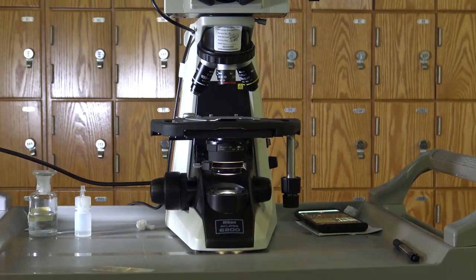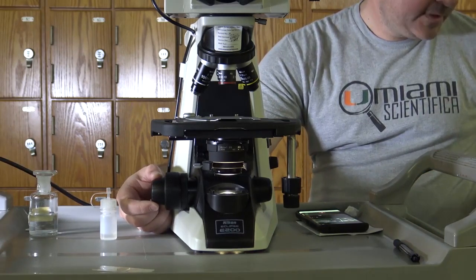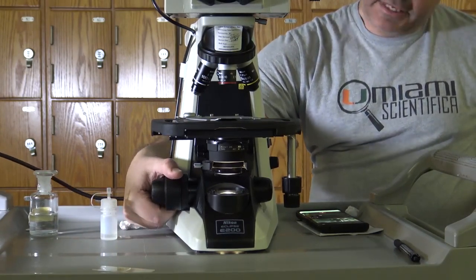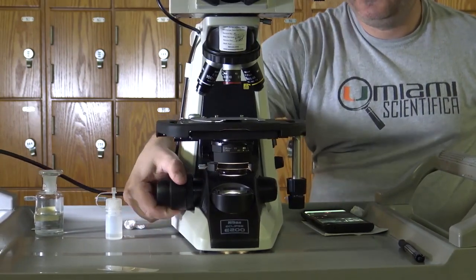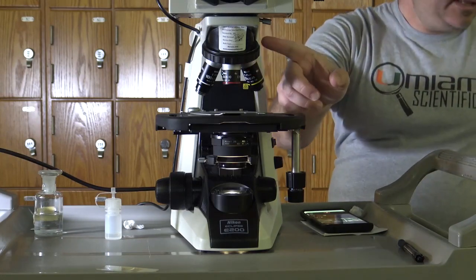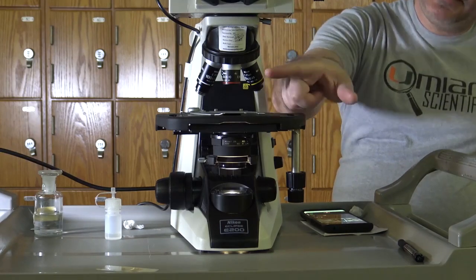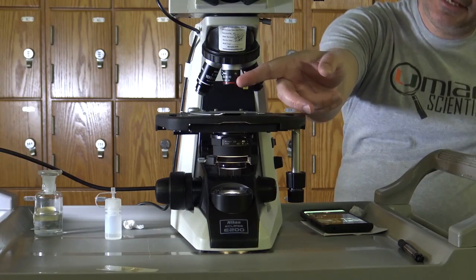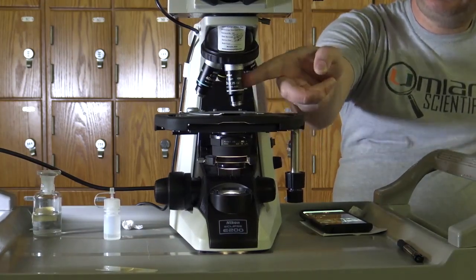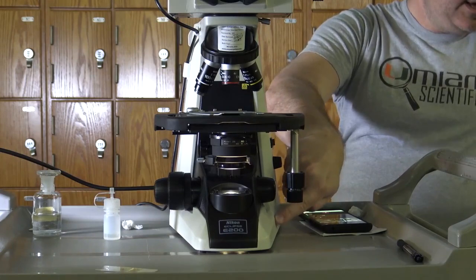So the fine focus knob allows you to make fine adjustments while focusing, and it is the smaller knob on the side of your microscope. The coarse adjustment knob allows you to make large adjustments while focusing, and should only be used when you're using the 4x objective. The objective lenses are housed in the revolving turret. So the revolving turret houses the objectives, and the objectives are as follows: 4x, 10x, 40x, and then 100x.